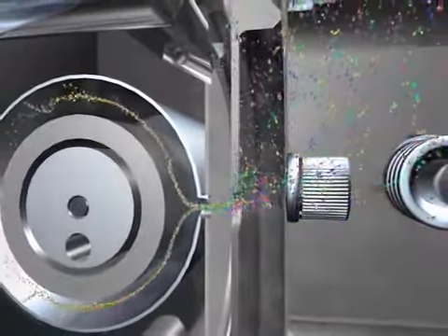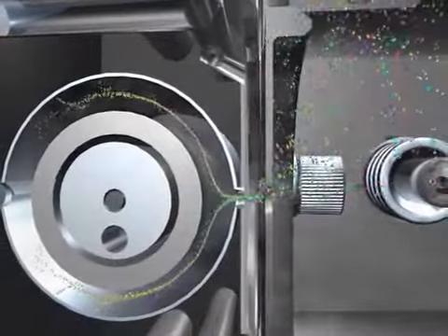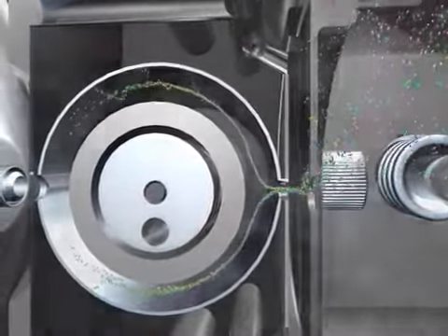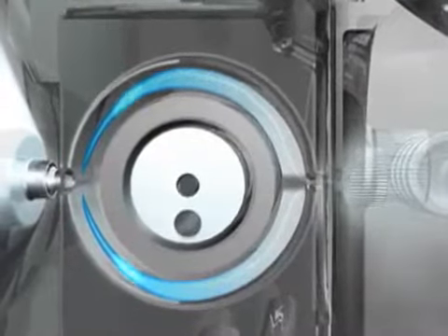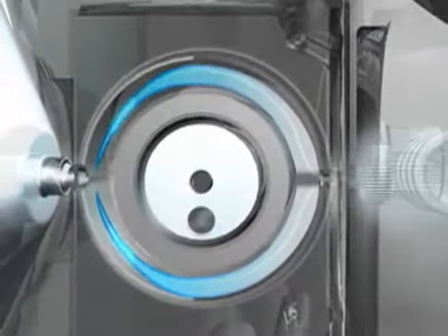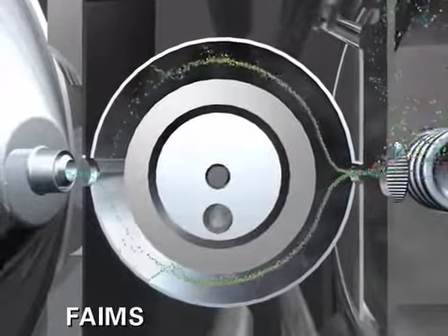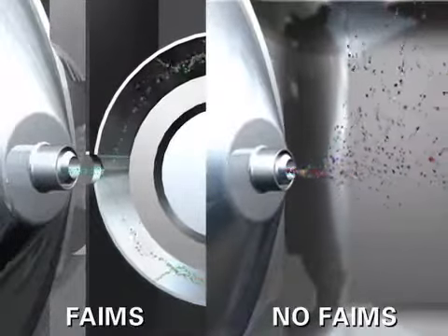Once inside the electrodes, on this center electrode we apply an asymmetric waveform, and this asymmetric waveform produces alternating high and low electric fields. The high field is applied for one time unit, followed by an opposite polarity low field component applied for twice as long. Since the magnitude of an ion's mobility is different at these two electric field strengths, the ion is slightly displaced away from the center of the FAIMS device.